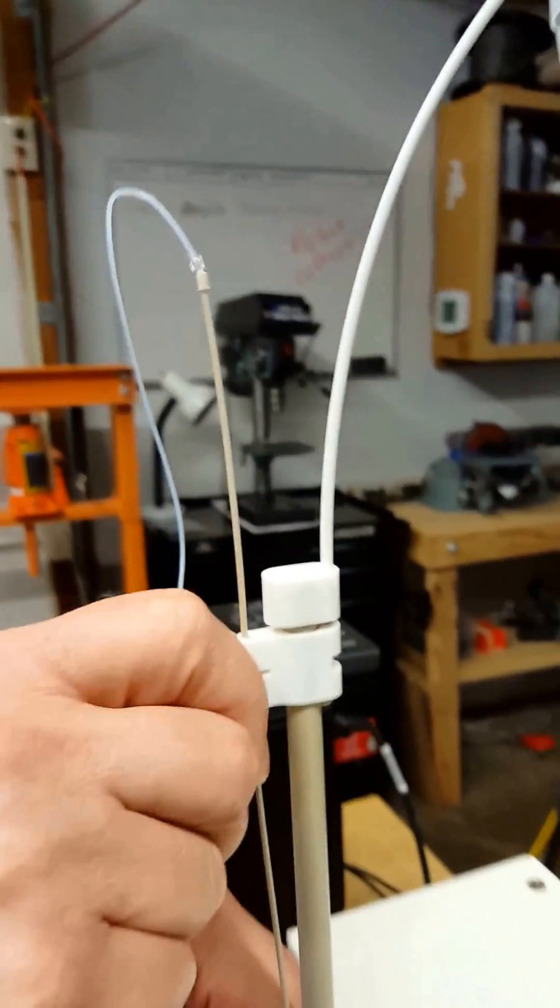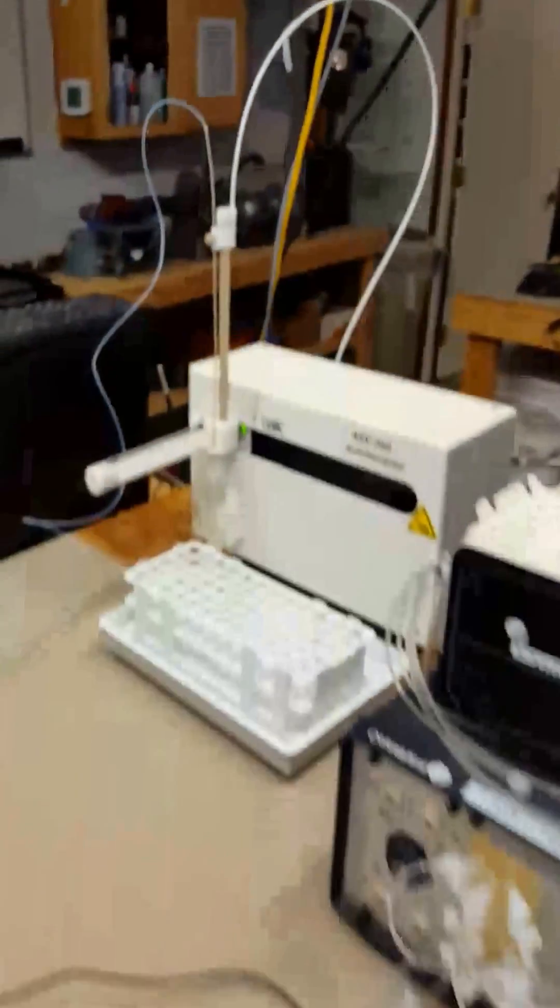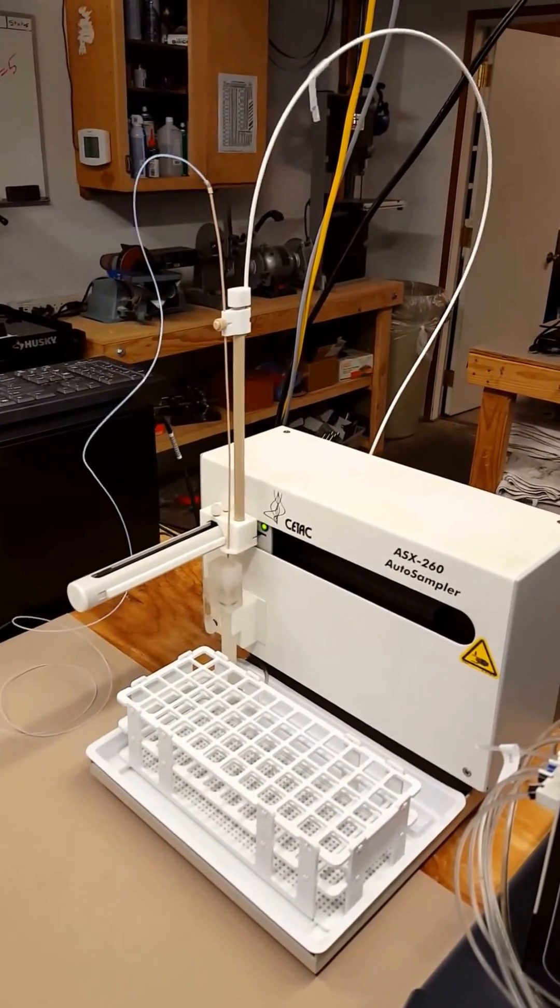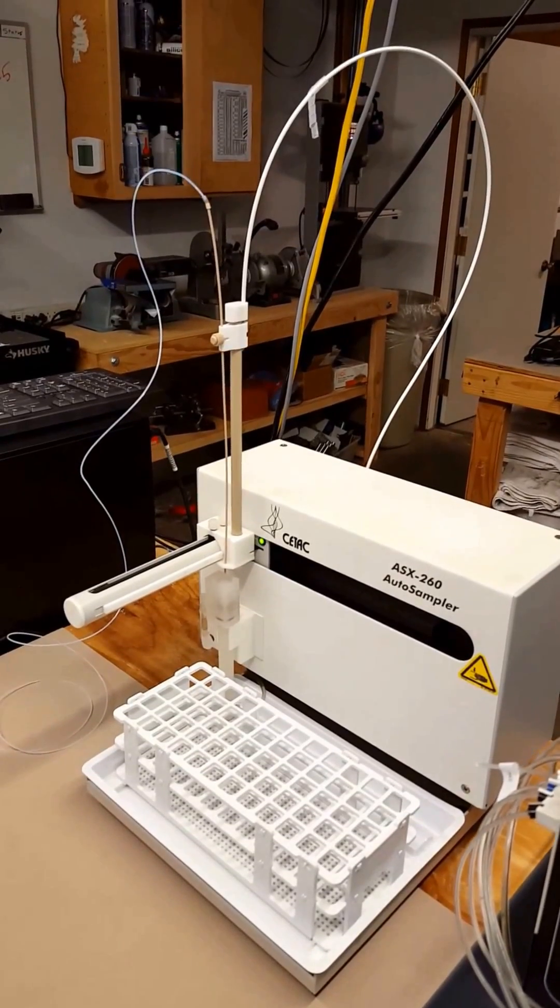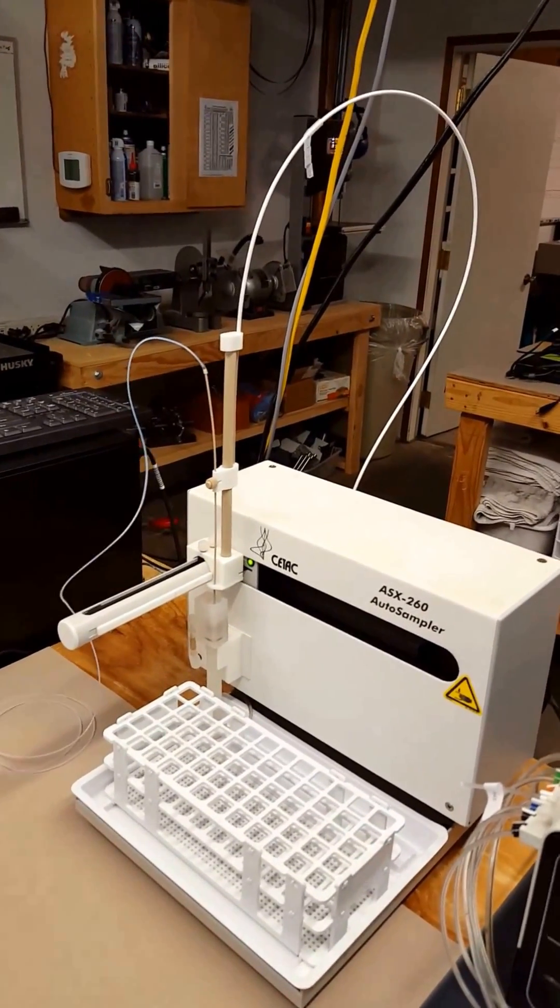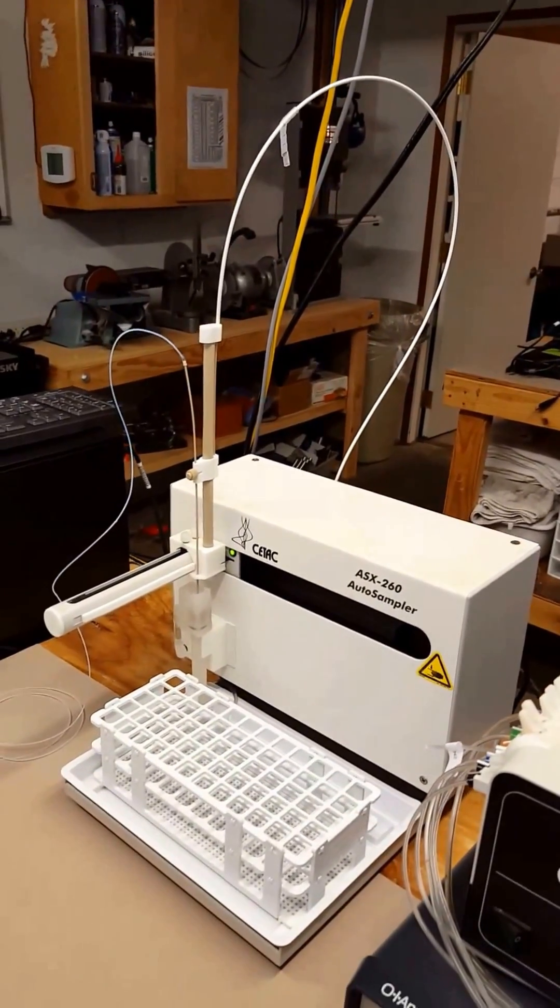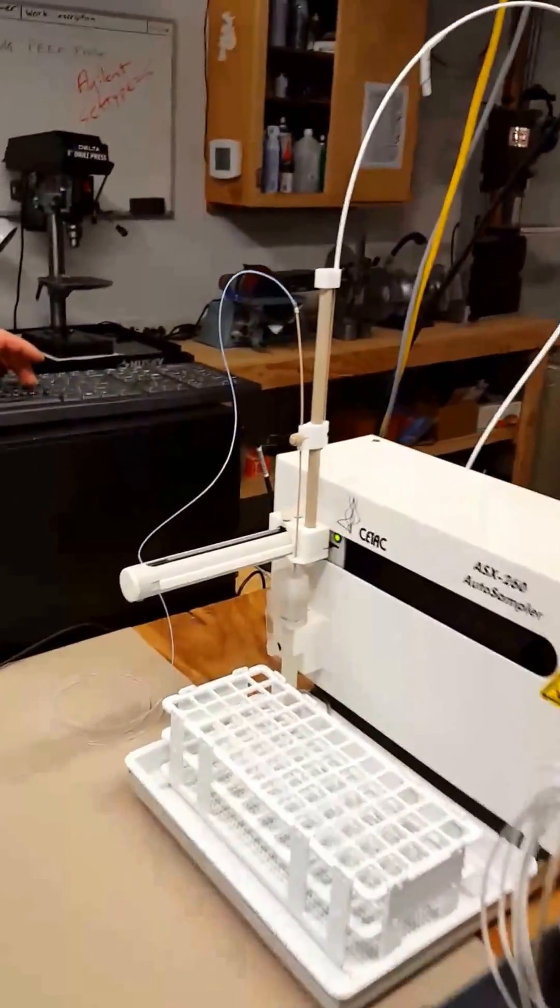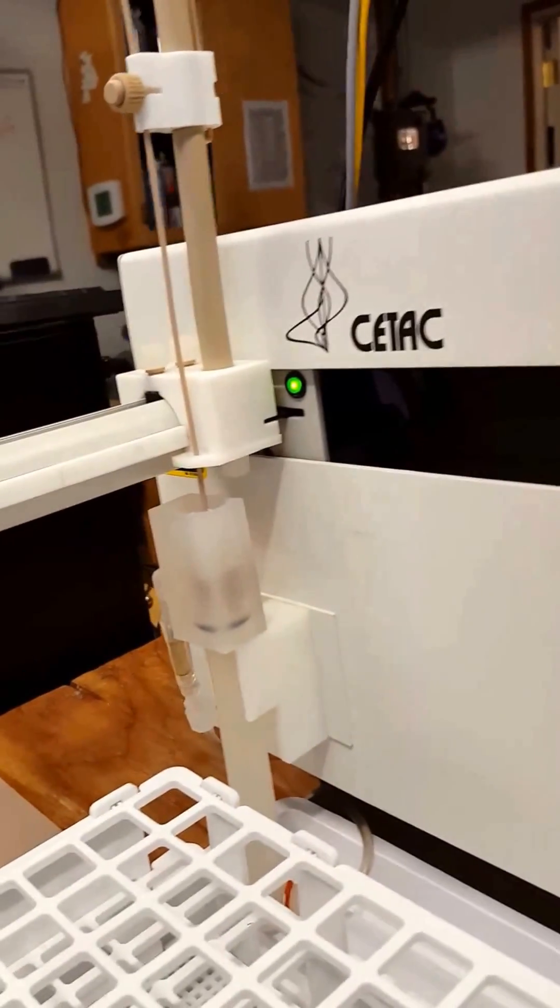When you go into the software, the probe arm assembly will initialize and go down. Then when you start a run, you'll see the probe arm raise up.